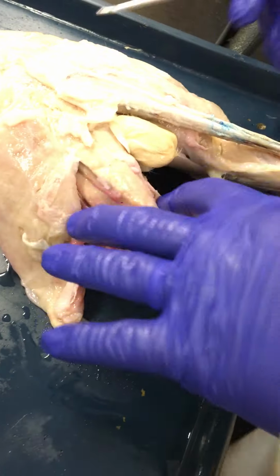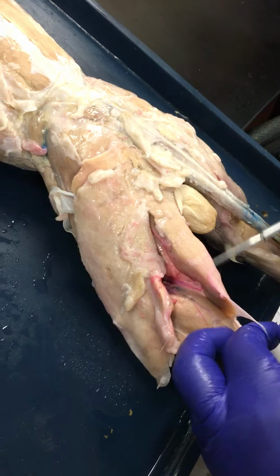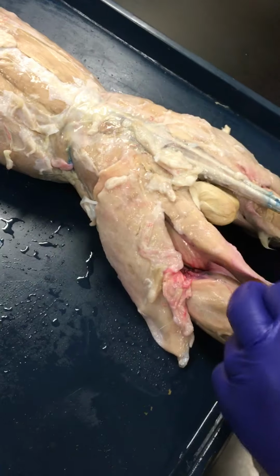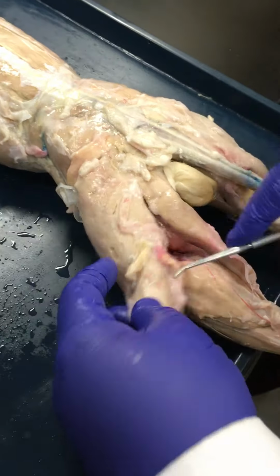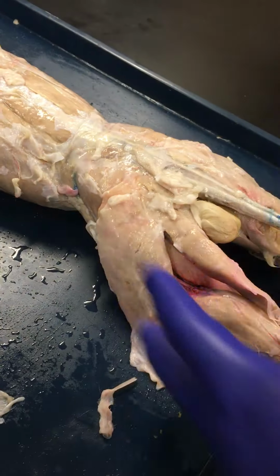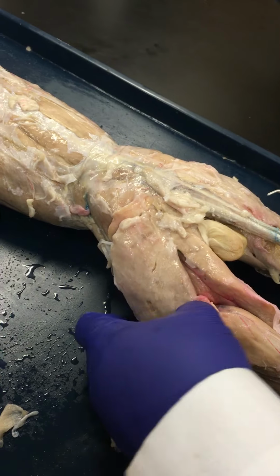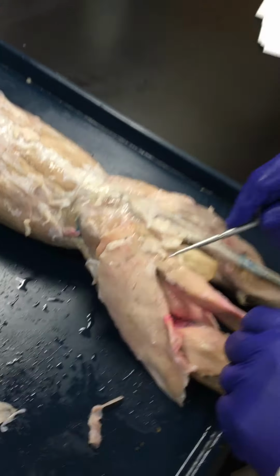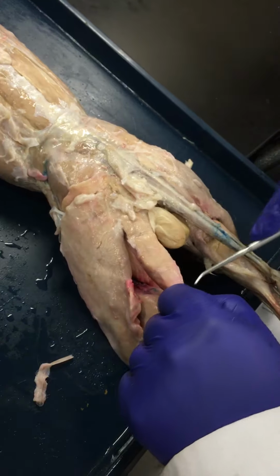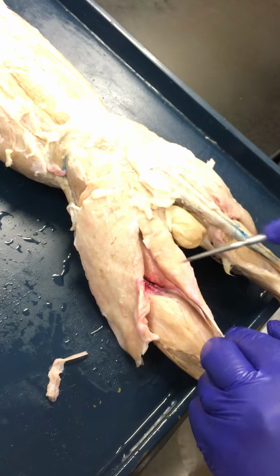Now as we make our way back up towards the posterior thigh, you see the hamstring muscles. These are the same hamstring muscles that earlier we saw from the anterior aspect, but now we're seeing them from this posterior aspect. When you look at the hamstrings, there are three muscles. The large lateral muscle is the biceps femoris. So this is your biceps femoris here. As you go medial, the superficial medial muscle is the semitendinosus, and then deep to that you see the semimembranosus. You see it on both sides.